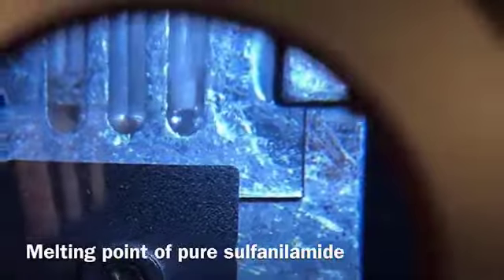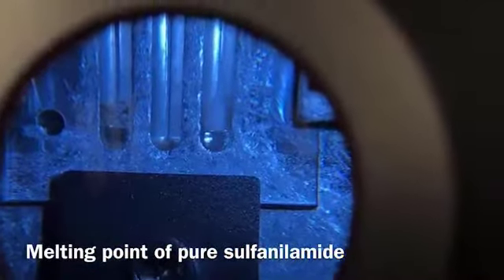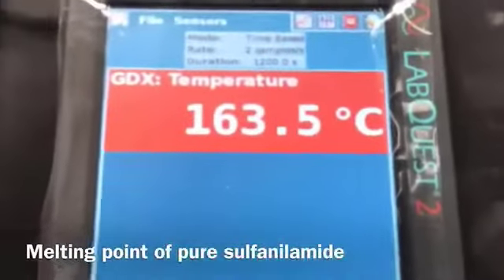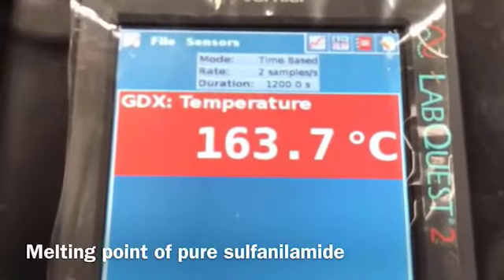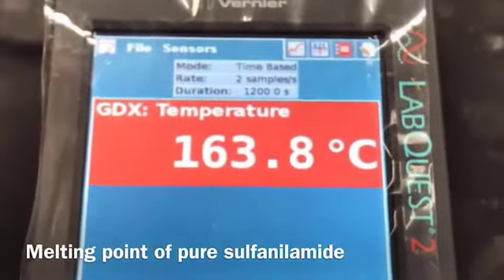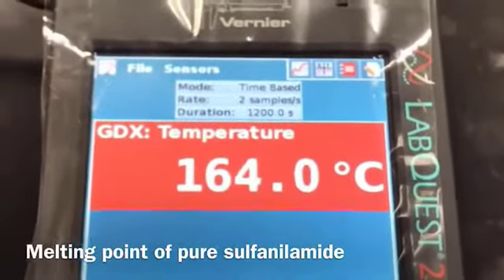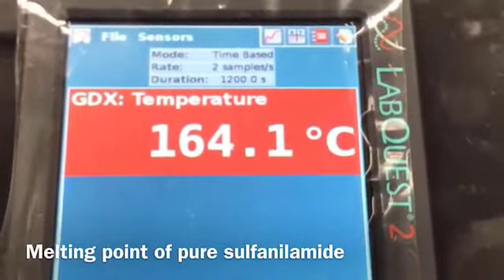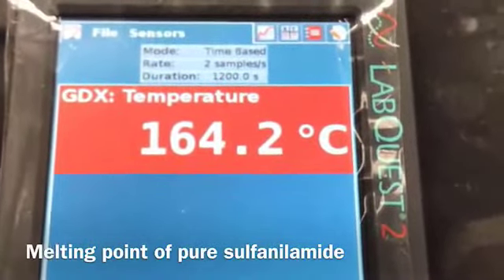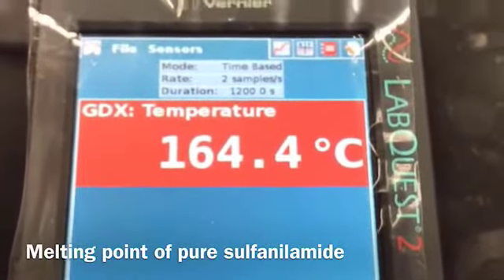As you can see, the sample is still solid in the right hand side melting point tube. It just started melting.